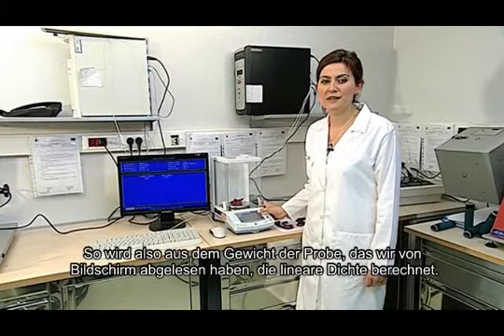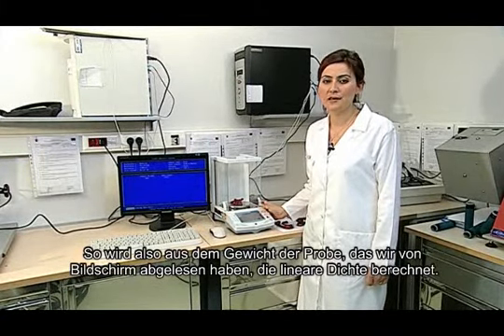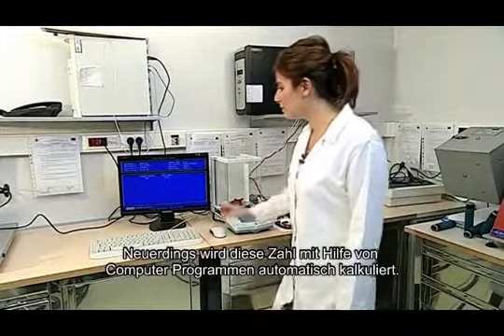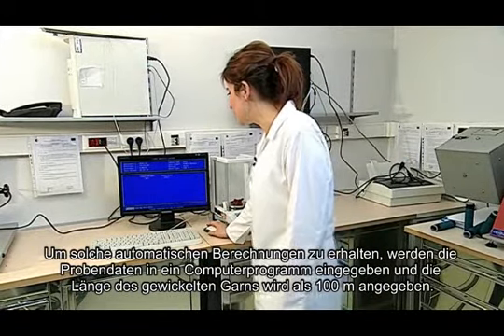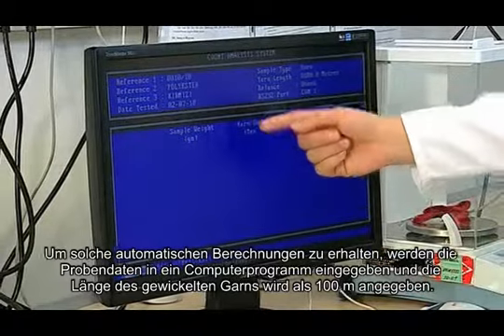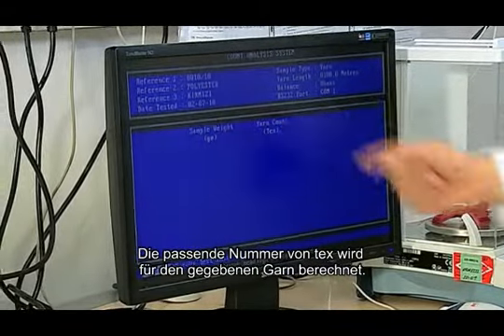Thus, the linear density is calculated by using the weight of the sample in grams that we read on the screen. Nowadays, with the help of computer programs, this number is calculated automatically. To obtain such automatic calculations, the sample's data is put into the computer program and the length of the wound yarn is given as 100 meters. The tex number in grams will be calculated for the given yarn.